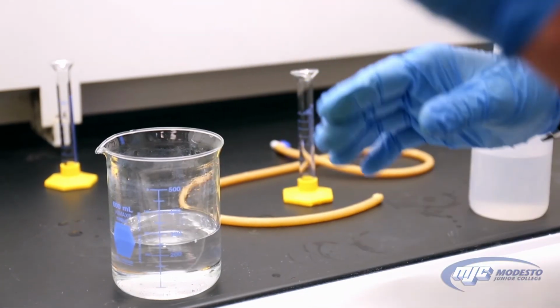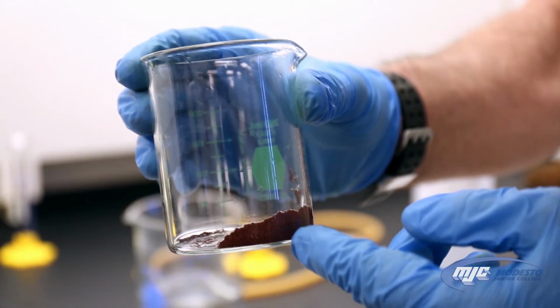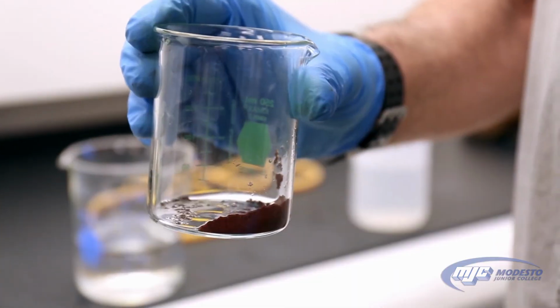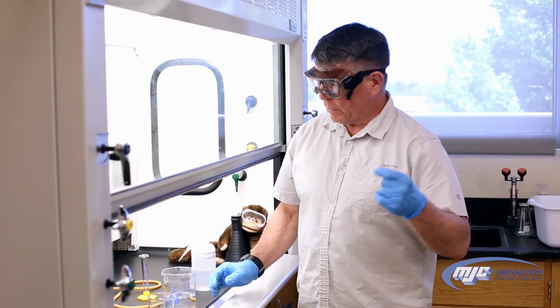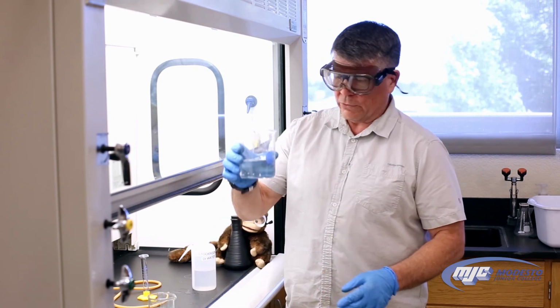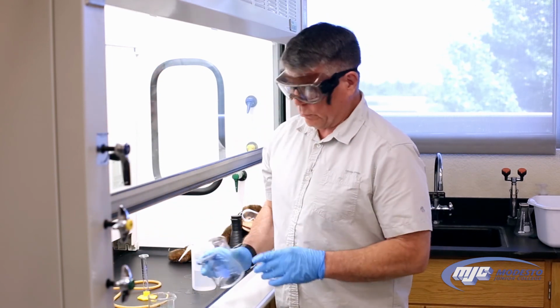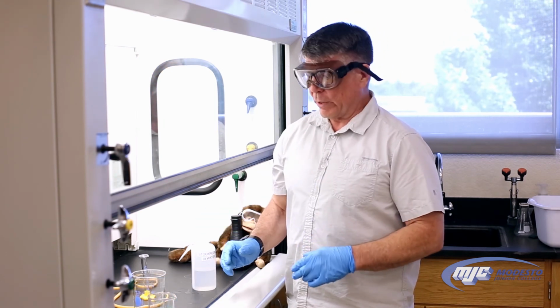Okay, so now we have wet copper here. We have one more thing to do. By the way, that copper right there is the same exact atoms of copper as we started with, that shiny copper metal that we weighed out in the beginning, exact same atoms. So now what we need to do is rinse it with some acetone. I'll tell you why in just a second, but first I need to dump this waste, which is just water, down the drain. Because the acetone waste we cannot dump down the drain. We have to put that into a special waste container, organic waste.